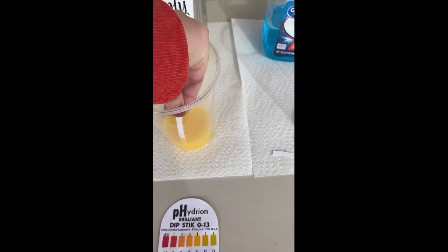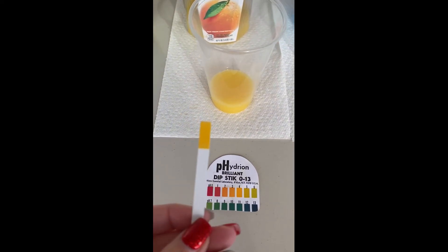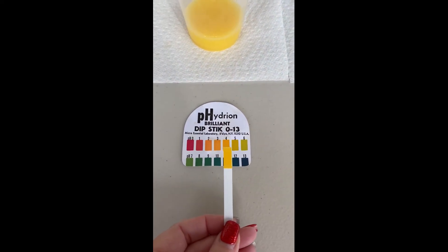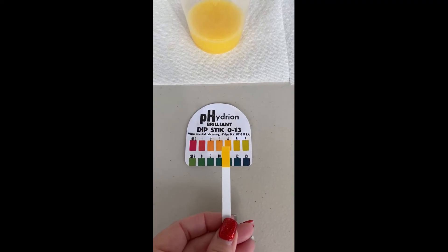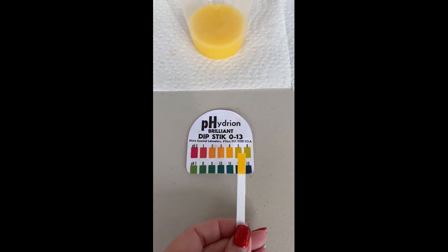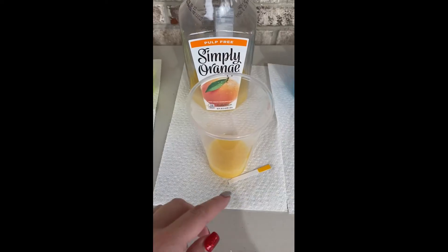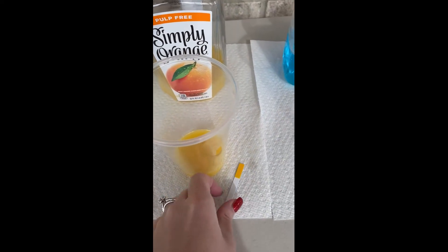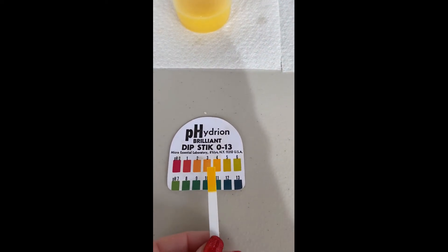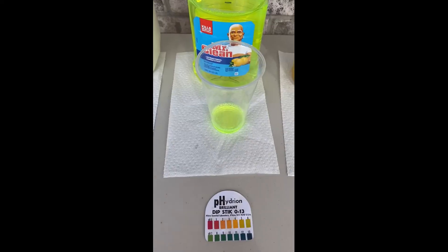So here we have our orange juice. You can see it doesn't turn colors right away — it's just a slight orange, so we can see maybe it's around a 3 or 4, somewhere around there. I did leave it and came back to test it because it was so bright and hard to determine those colors. Those yellows are very hard to determine right away. After some time, you can see it's definitely a 4.